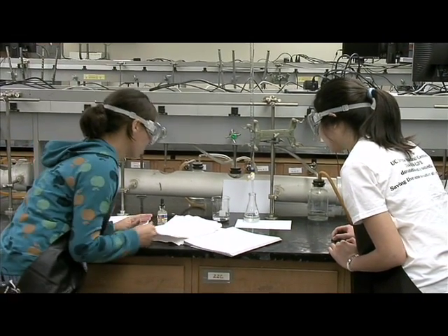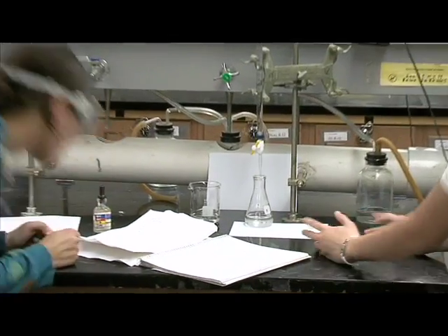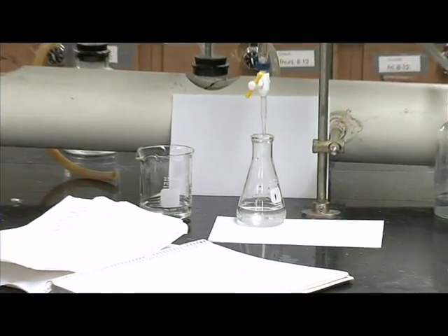Ooh, that one's close. Oh! Oh! It's pink! It's pink! Your favorite color! Oh, gag.